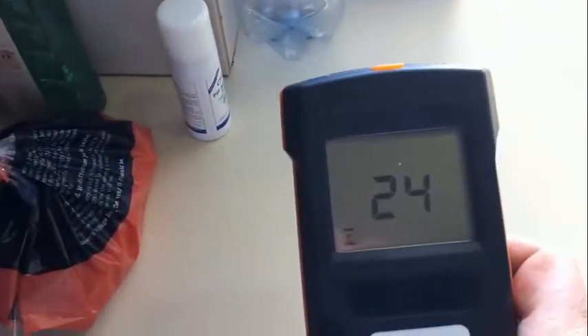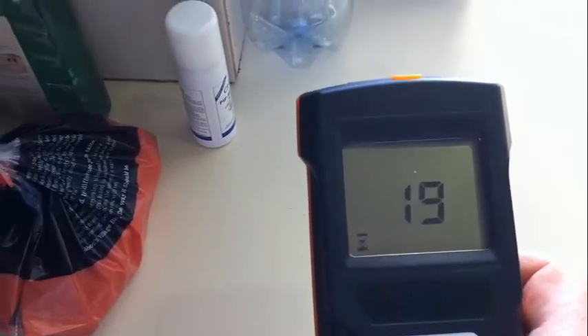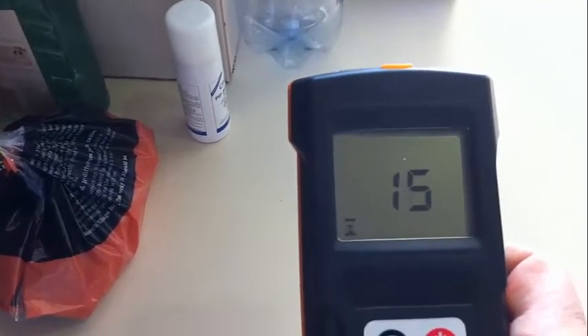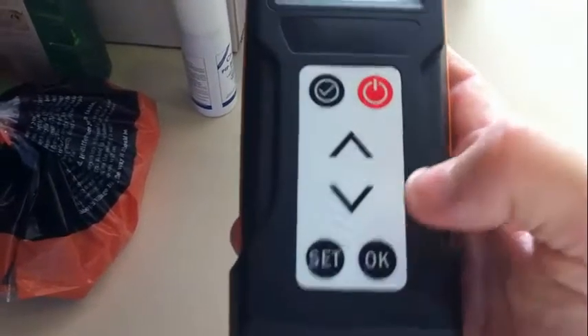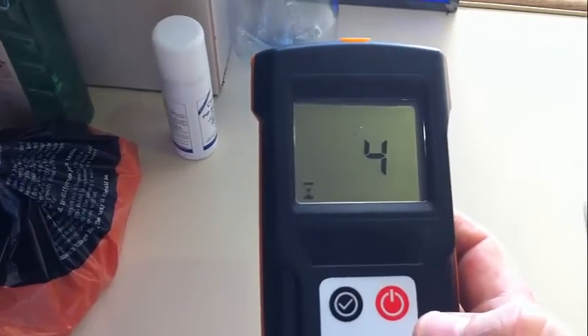You do need to be careful if you've left the unit in the top there — it will show you that you've got a unit and you have to get it out with the little arrow at the bottom, showing a little lid coming up and an arrow going out to say get out of here. Take it out. You may need to press the OK button a few times just to set the date, depending on how recently you set the date with the battery in it or not.